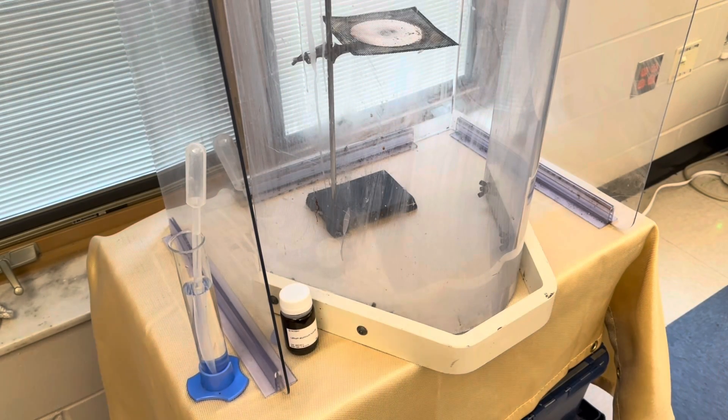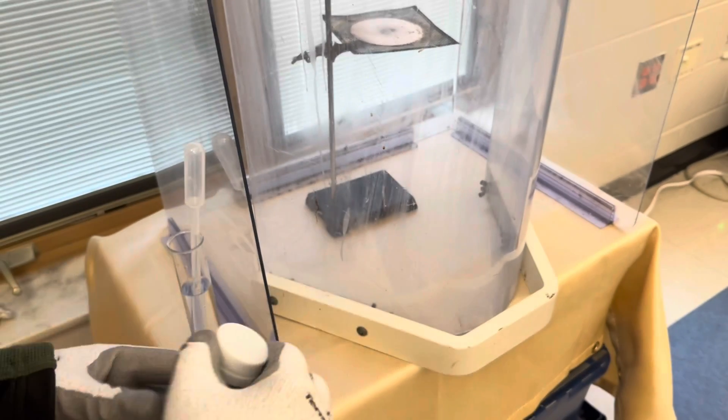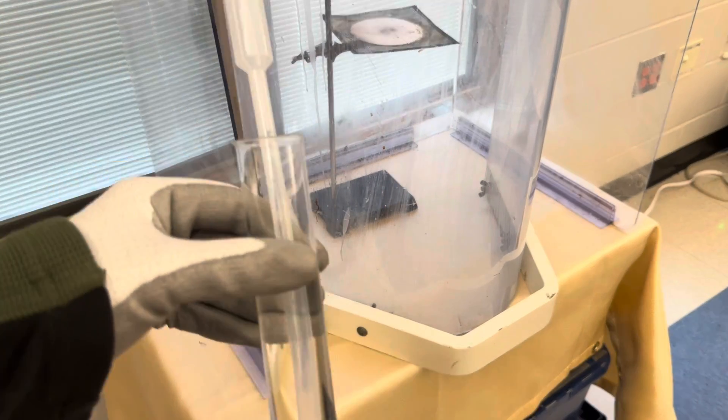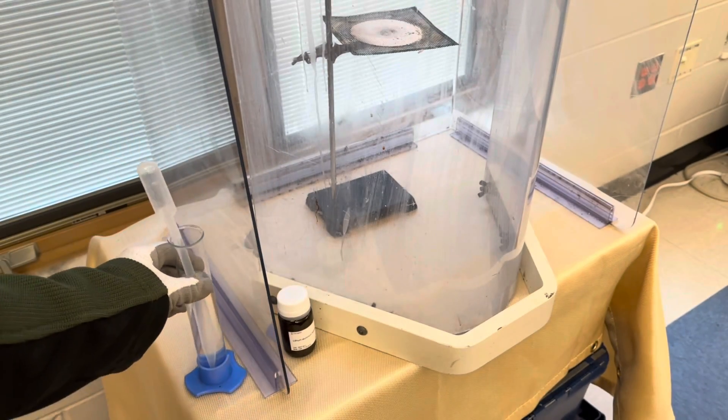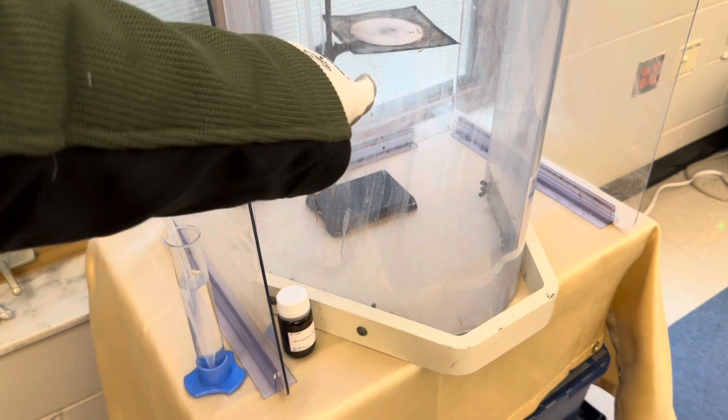For this demonstration, we'll test one gram of lithium aluminum hydride. We're using a dropper and distilled water, a blast shield, and a ring stand.